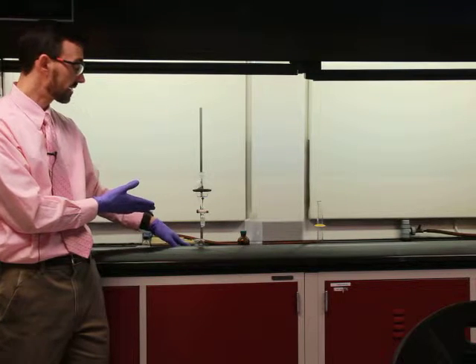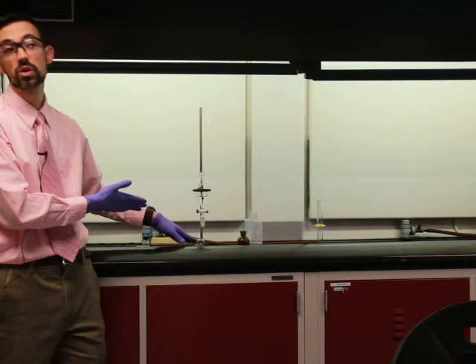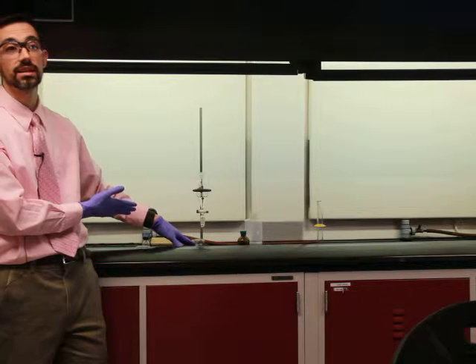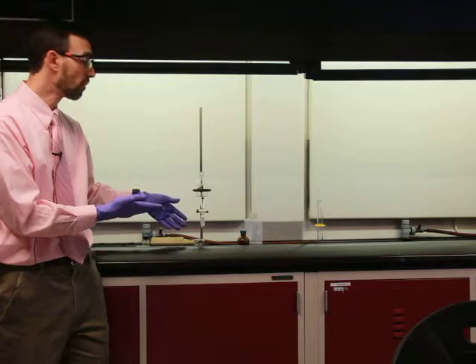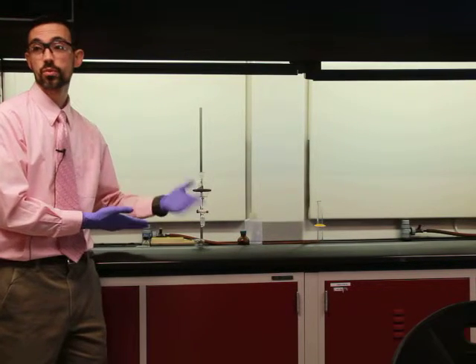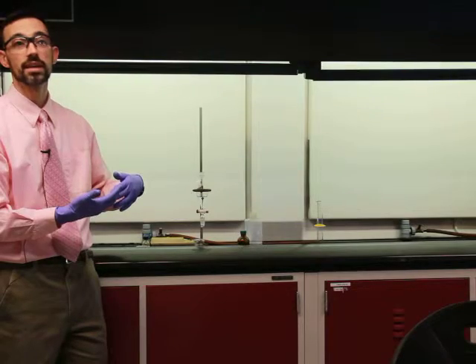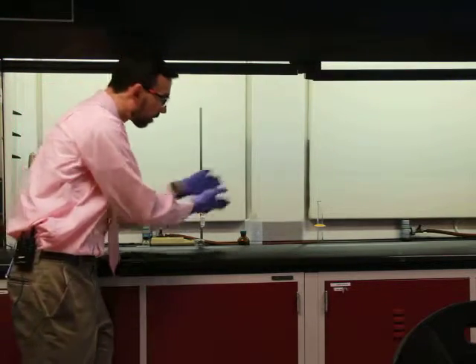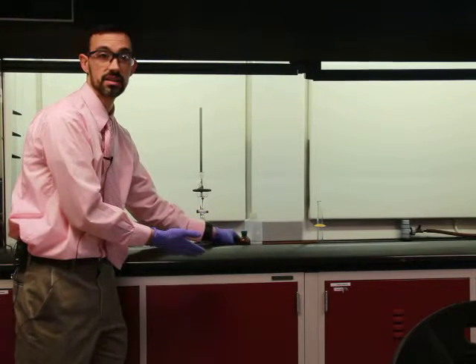Right now, maybe I've gotten 75% of my acid molecules. I don't know what the partitioning ratio is exactly for this unknown acid that I'm working with. So if I don't know, I'll probably do 2 or 3 extractions to maximize the amount that I am getting. And then I would collect all of the aqueous water fractions together in that case.